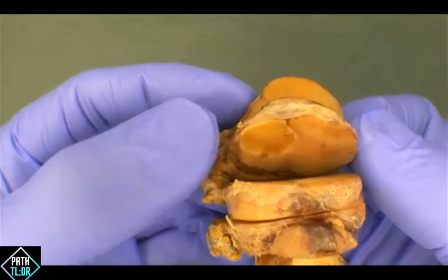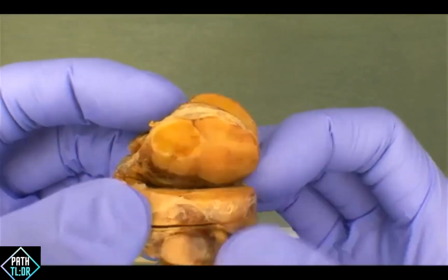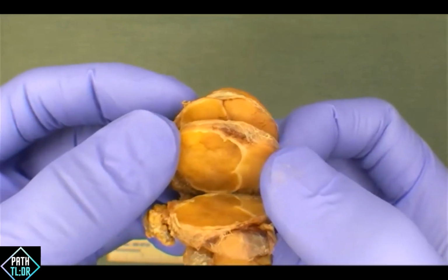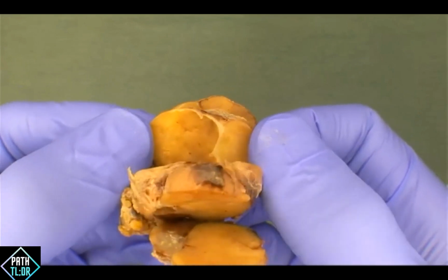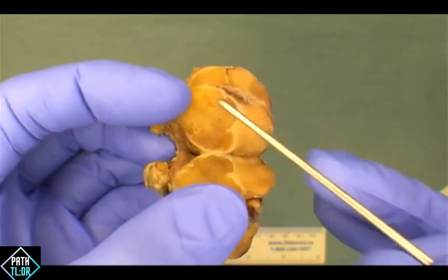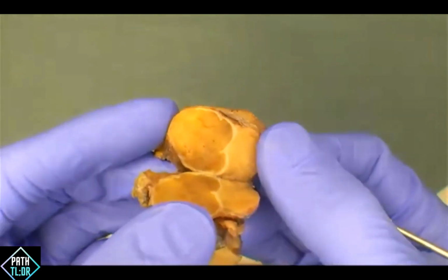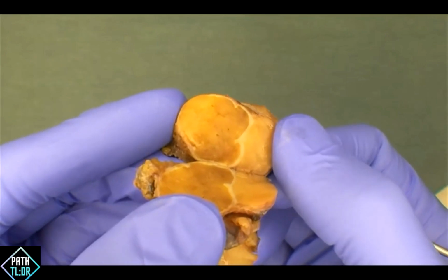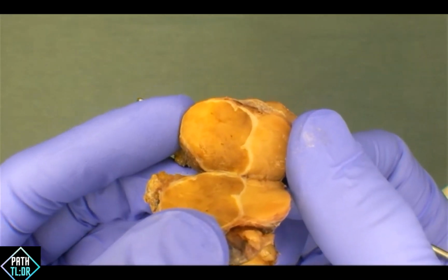We would have to look at the capsule to decide what this is and whether this turns into something more malignant than perhaps benign. And I think that's the important part here in terms of sectioning for this particular specimen. We want to ensure we evaluate the entire periphery of the lesion. And for this, it'll be easy because it'll fit into a cassette without too much effort. You'd be able to evaluate that histologically to then decide which way it goes.